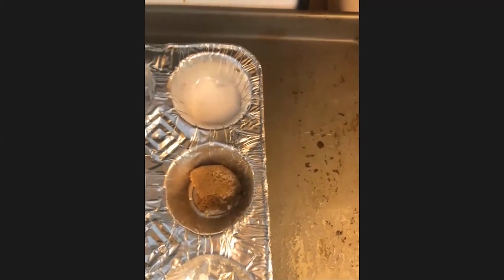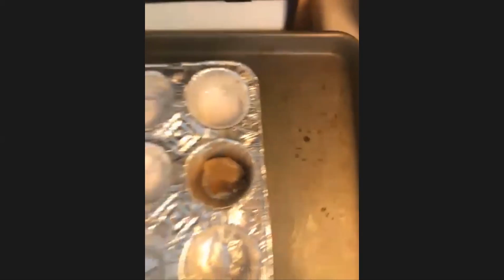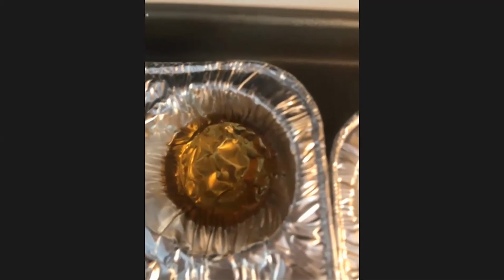Okay. But no progress yet with any of the other substances? Well, I'm still a little nervous about that gasoline, but I'm not seeing anything happen on the olive oil yet, or on the motor oil. The gasoline is almost all boiled off, so at one level I'll be glad when it's gone.